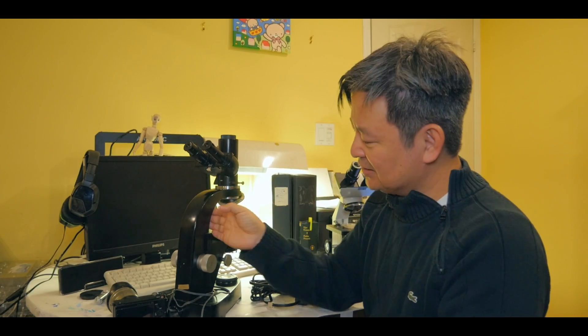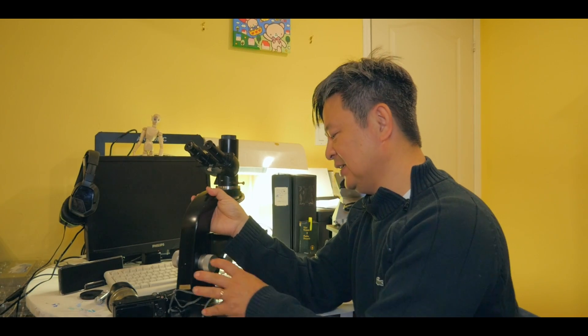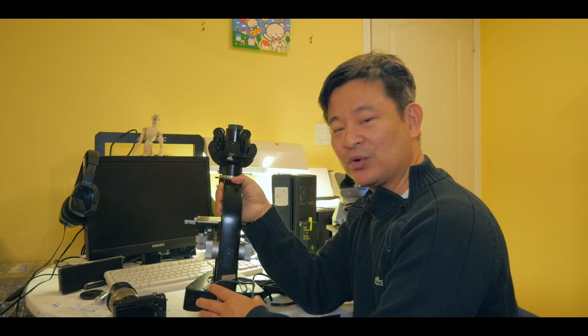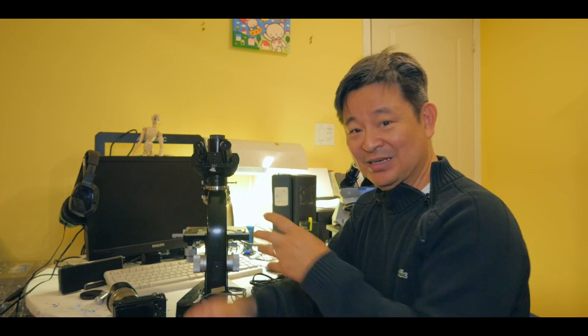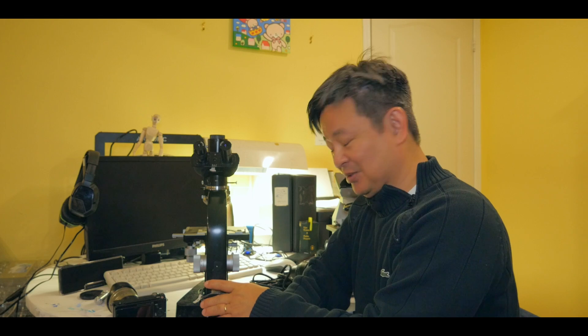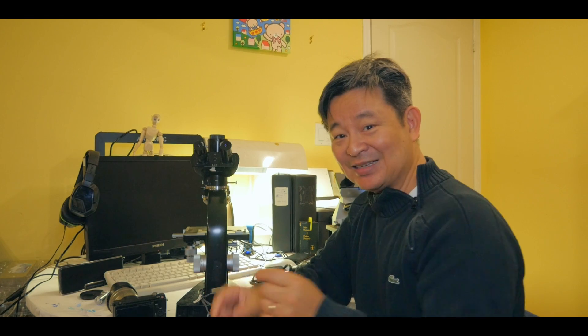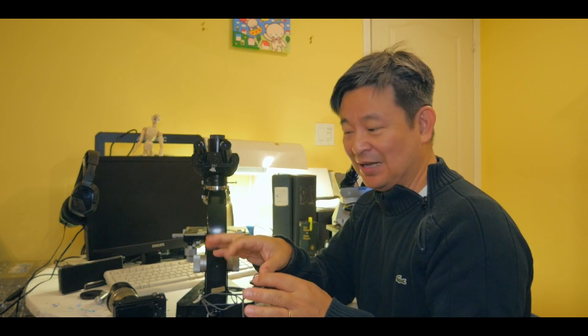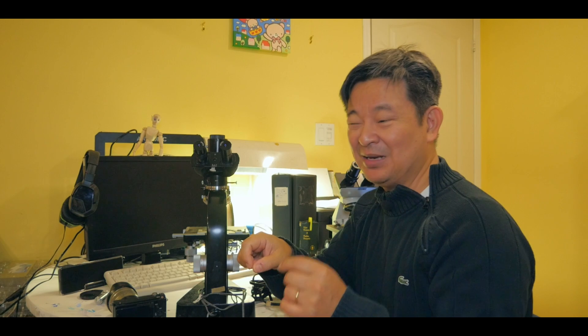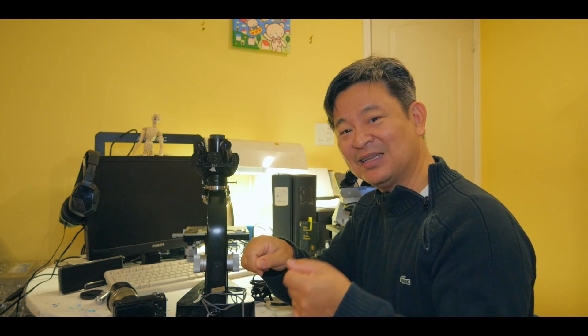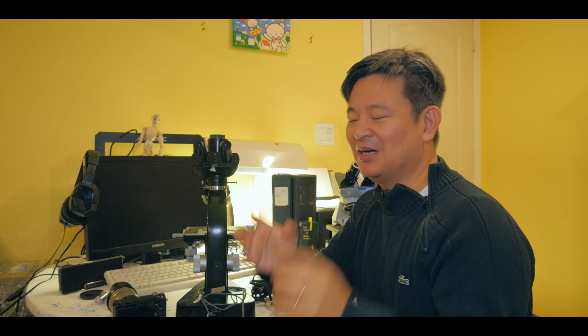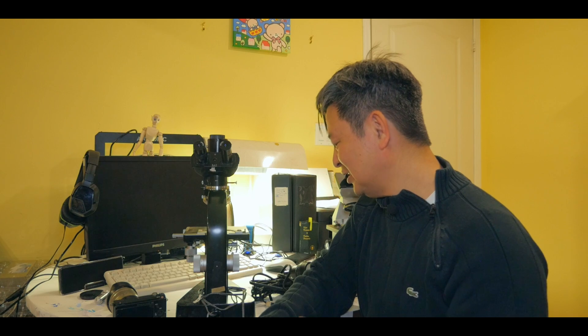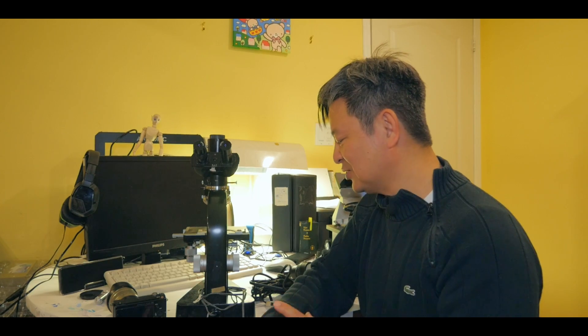It's missing other objective lens. In addition, what's the worst part is that the light source that comes with it is this old halogen lamp source. It works, but the thing is, it didn't come with a transformer. This type of microscope comes with a big transformer, which didn't come with this microscope. So I actually ended up trying it out with my lithium battery. It works. And then I made a mistake by plugging it directly to the AC power plug and boom, the light bulb broke apart.